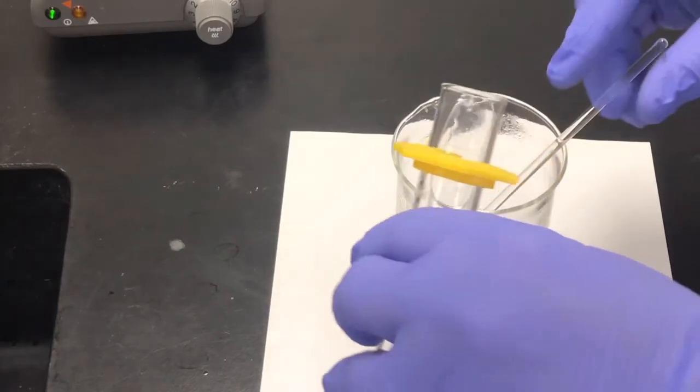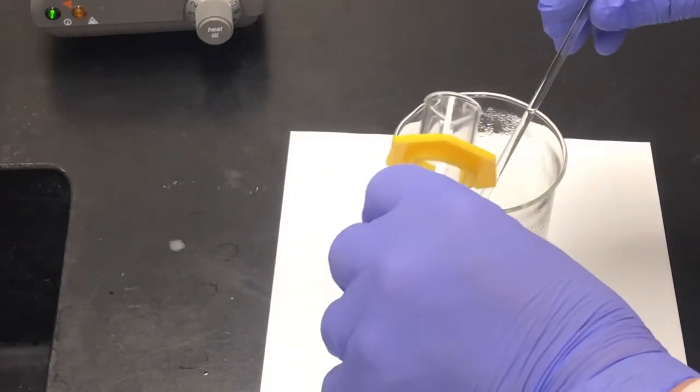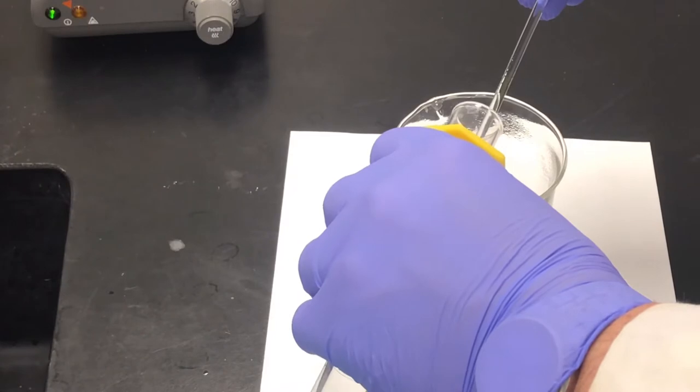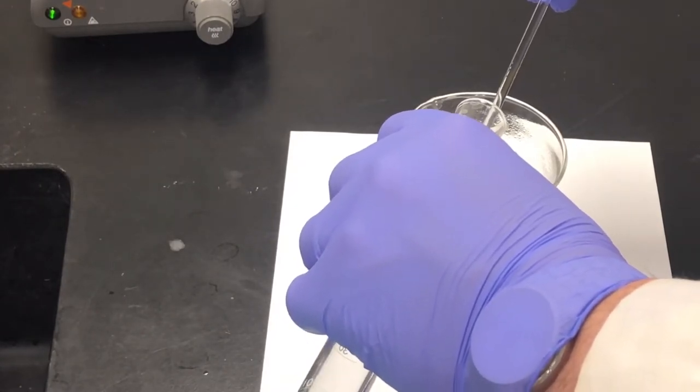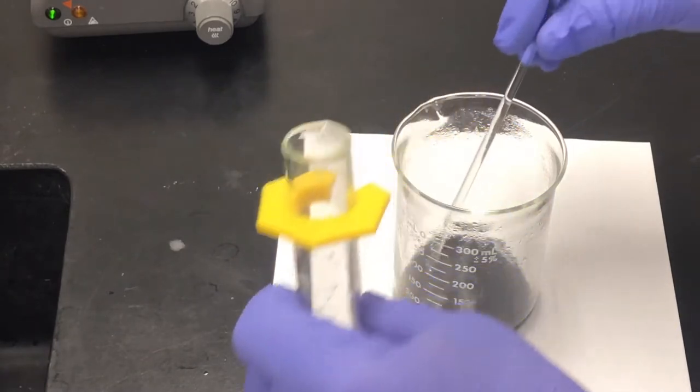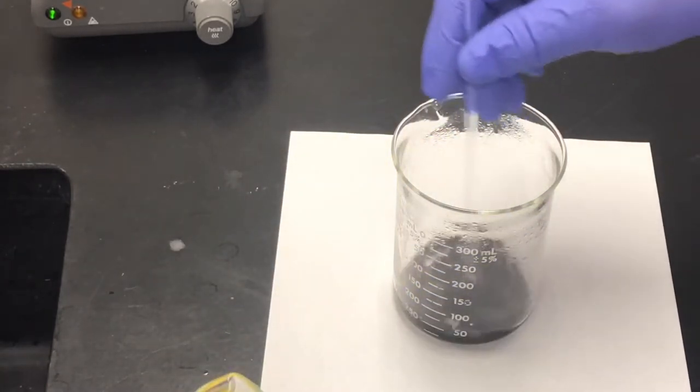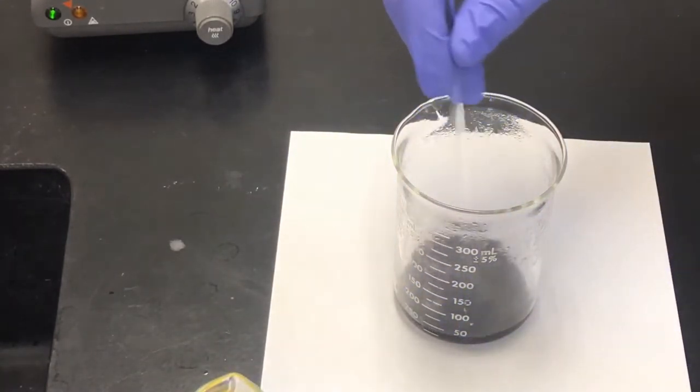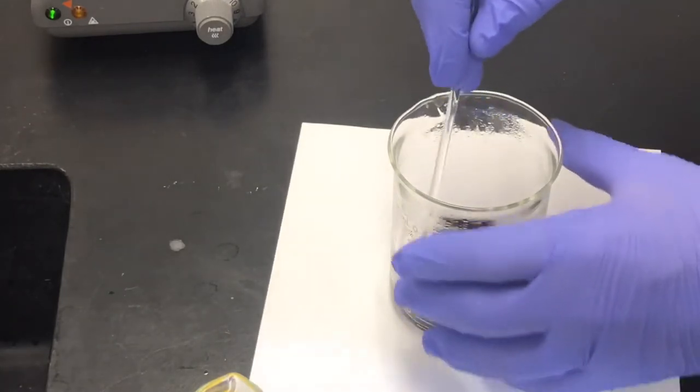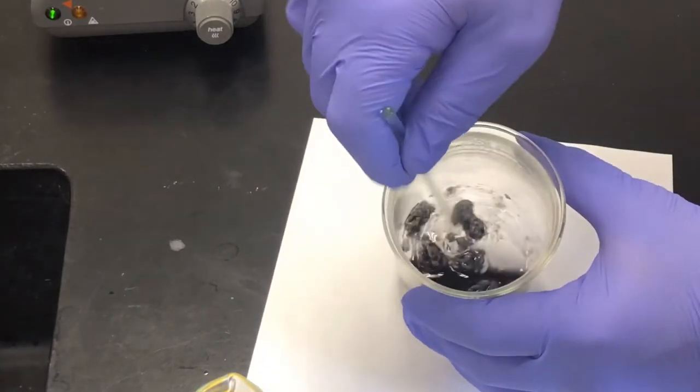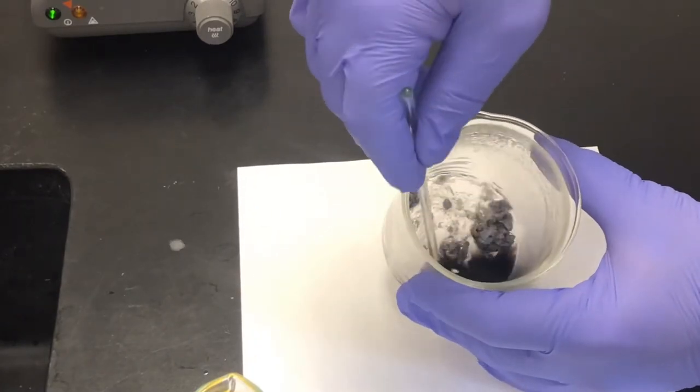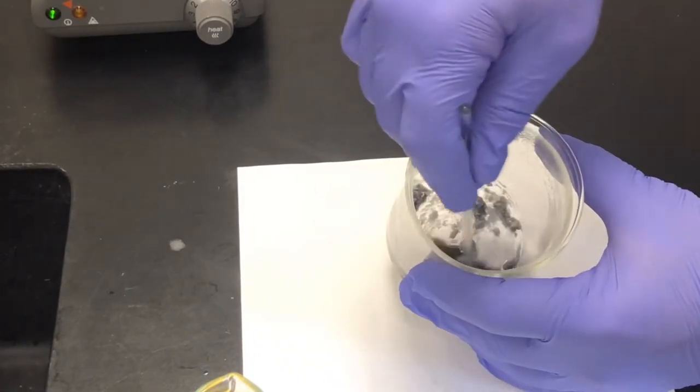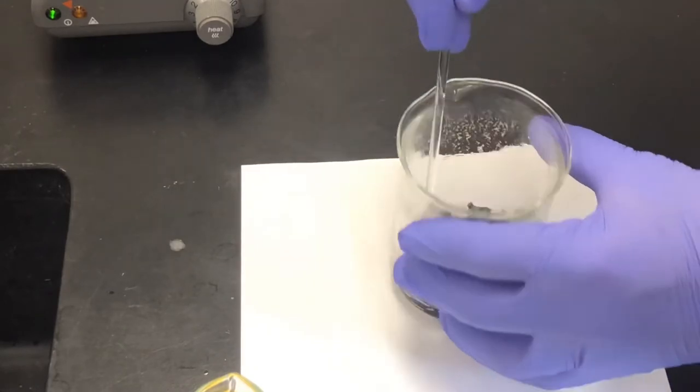So hopefully I've zoomed this in. I'm keeping my face away from the top. I can add this little stirring rod to the tip of this. I'm going to stir this in. And I don't know if you can see it. We've got some clumps that formed immediately. They're all big white clumps.